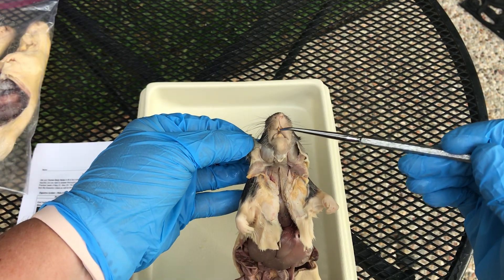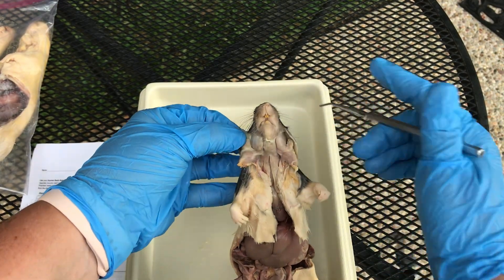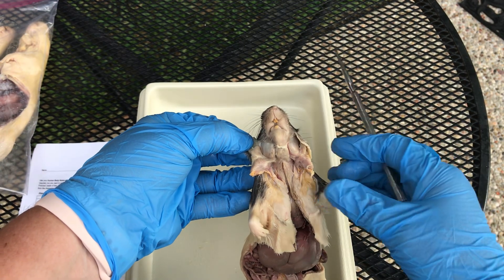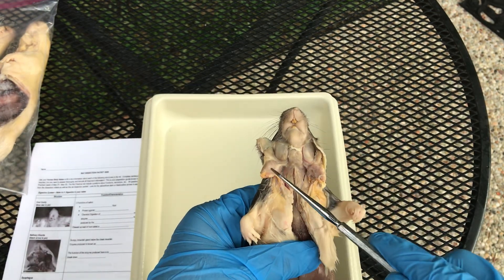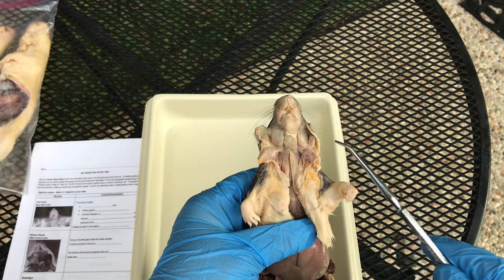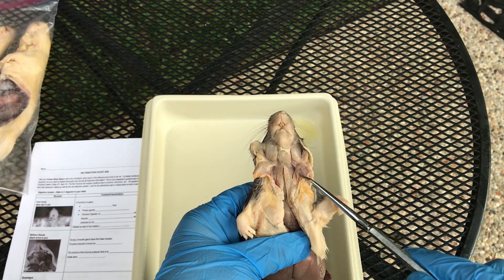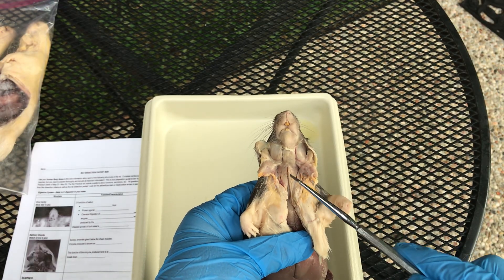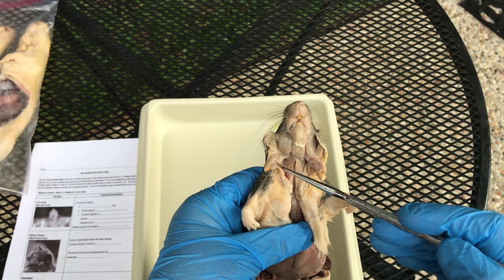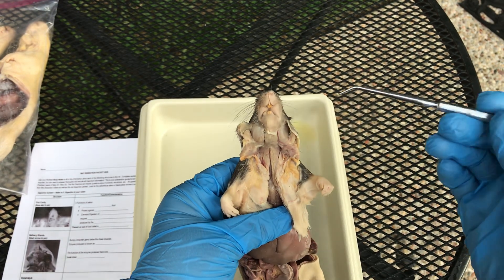In the oral cavity, we have mechanical breakdown of carbs, lipids, and proteins through mastication, as well as chemical breakdown of starch. These large glands here are called salivary glands — rats have three pairs but you only need to know the large ones. Salivary glands secrete an enzyme called amylase, which is used for the chemical breakdown of starch. Starch is a polysaccharide, and amylase breaks those polysaccharides down into disaccharides, working toward the monomer form.